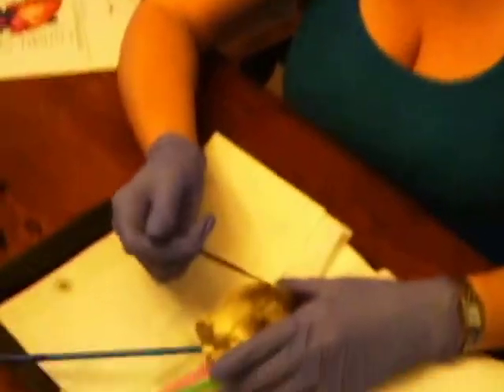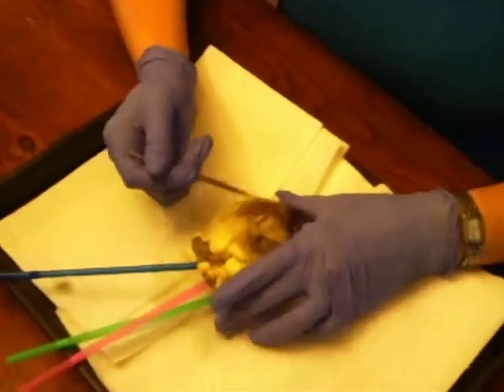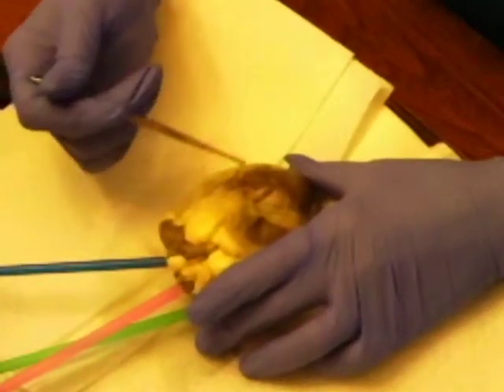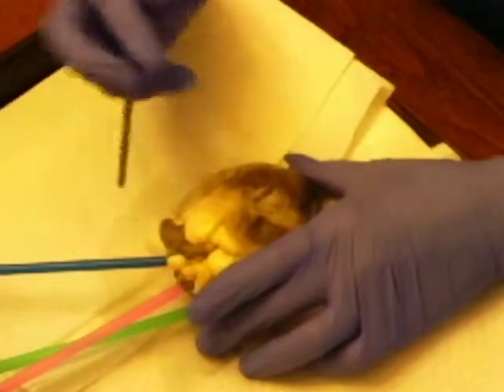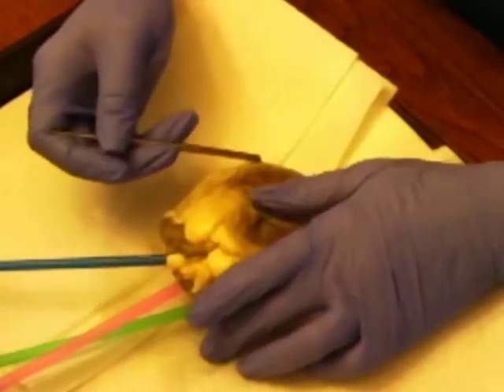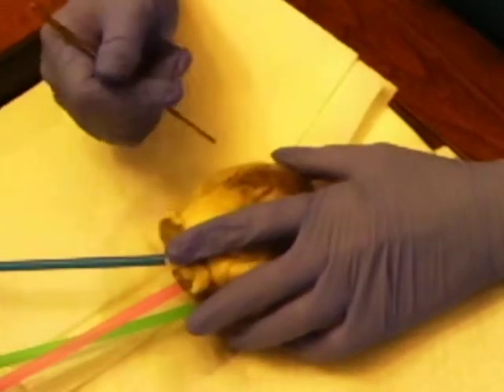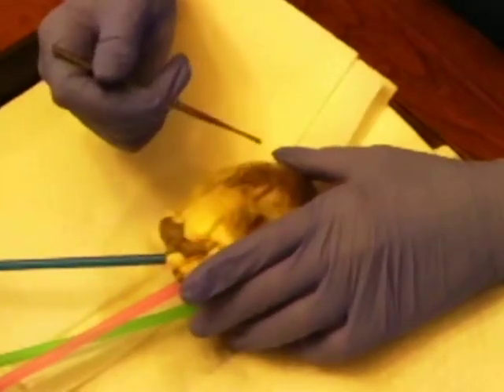We're going to be looking first at the external anatomy of the heart, and the first term to define is the visceral pericardium, otherwise known as the epicardium, which is the outer layer of the wall of the heart. It's composed of connective tissue and is covered by epithelium. The epicardium is also known as the visceral pericardium, and it provides an outer protective layer for the heart.